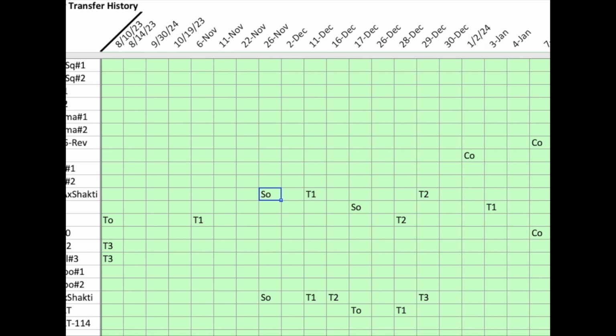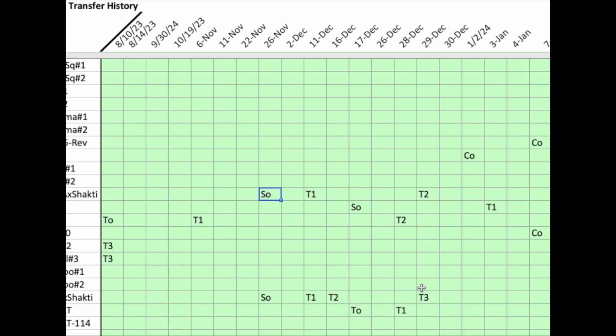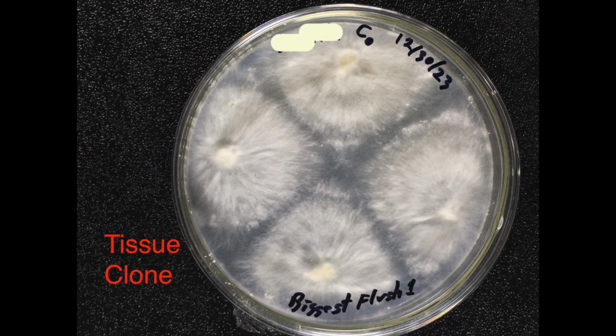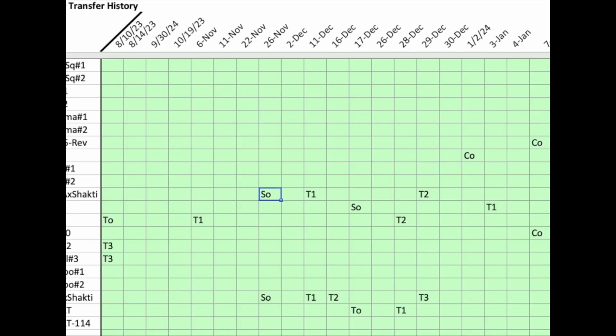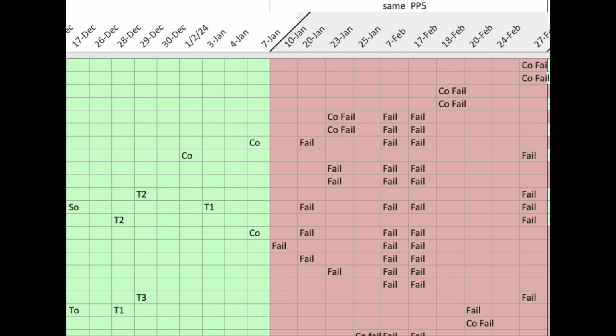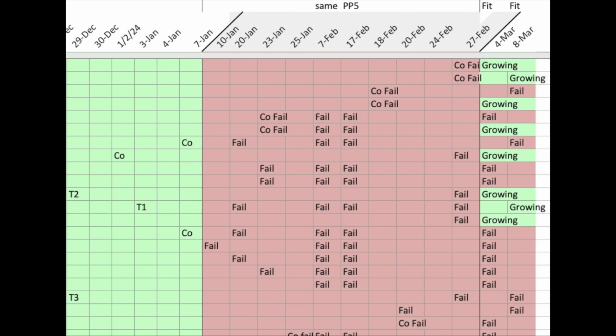Up until the start of 2024, I'd been successful with several swabs and, of course, agar transfers, and clones of tissue had also been growing. With this data, it was pretty obvious that things began to fail right away in the beginning of January, and nothing would grow. The clones, transfers, from dish to dish, everything failed.